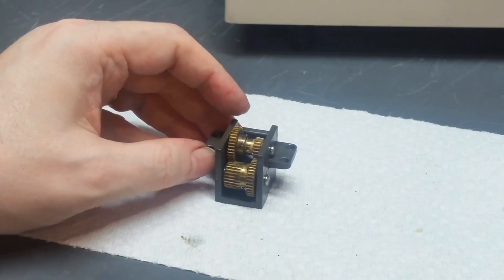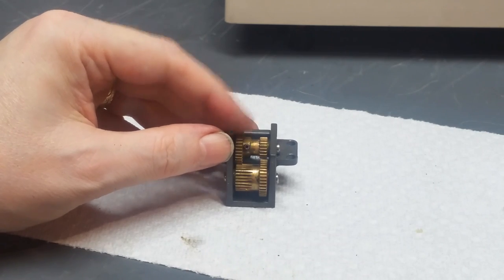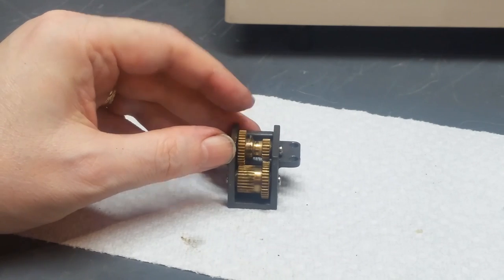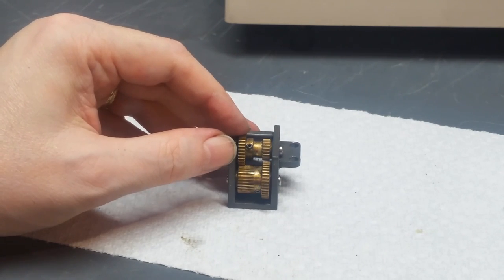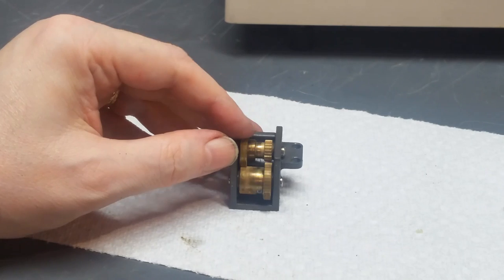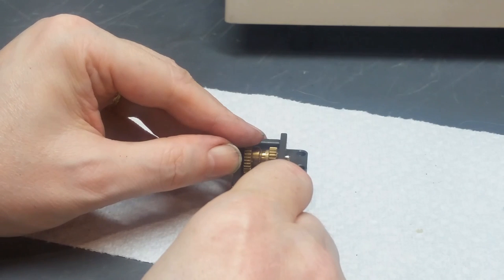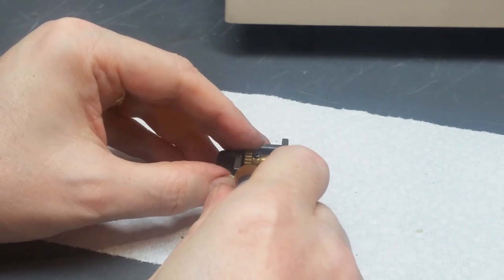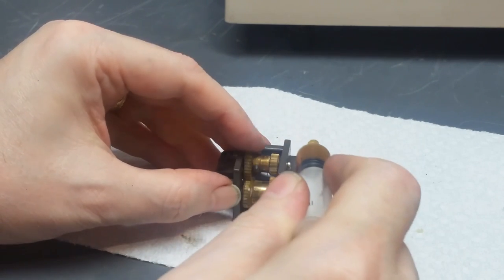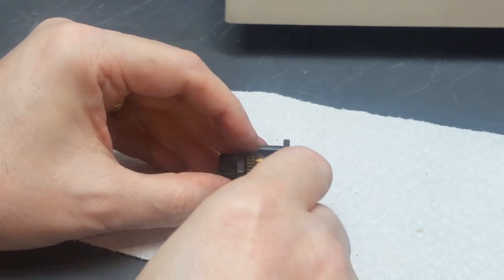Now what I want to do, and this is another controversial thing, a lot of people say, don't grease this rack, because if you do, things will stick to it. If you operate in a dirty, dusty environment, things will gum this up, and yeah, you're right, it will. They're right, it will do that. On the other hand, grease reduces wear, and I'm basically building this for somebody to use in their house, maybe in their basement, but certainly not in a dusty industrial place, so I'm going to grease it just so it'll last longer. If the thing ever gums up, I'll clean it and do it again. So I'm putting grease on all these surfaces. And I'll go ahead and grease all these as well.